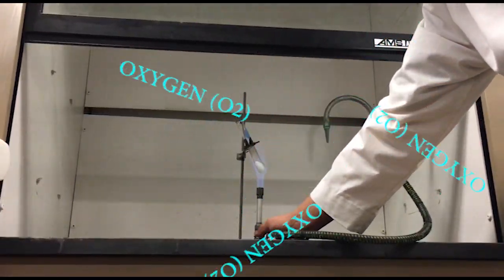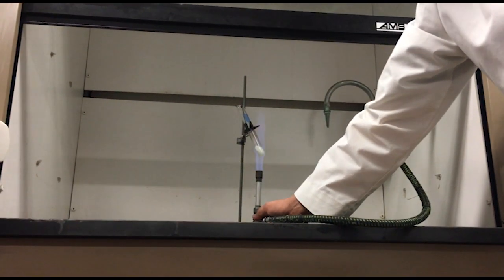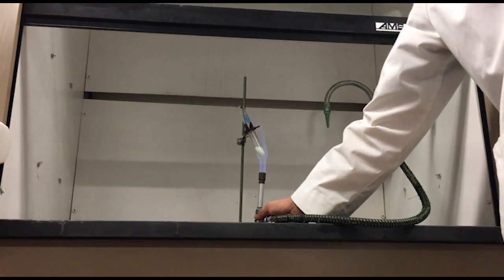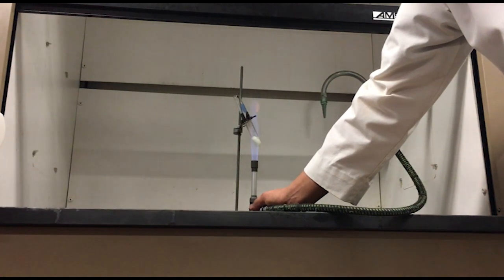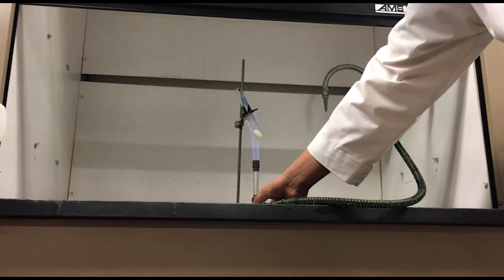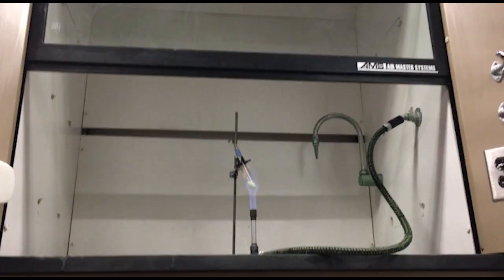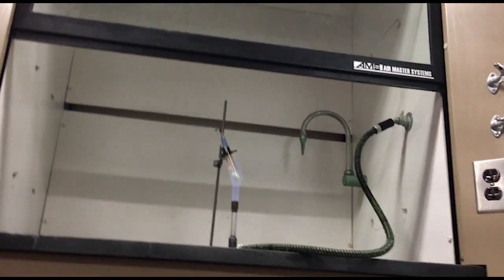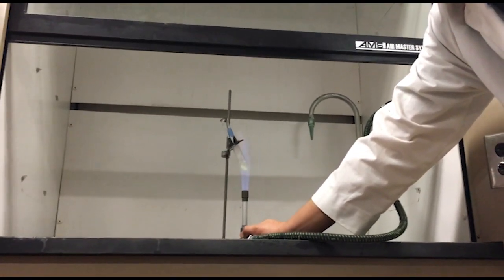Oh boy. Now, in order to have a fire, you have to have an ignition source, which I guess we have here because there's quite a bit of heat. You have to have oxygen, which of course is being produced, but you also have to have fuel, and there is no fuel in there right now to cause the oxygen to blow up. But we're going to put some fuel in there in a minute in the form of these pieces of wood. Okay? So, we're not going to put gasoline in here because we don't want to die.